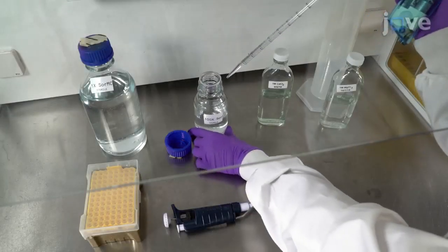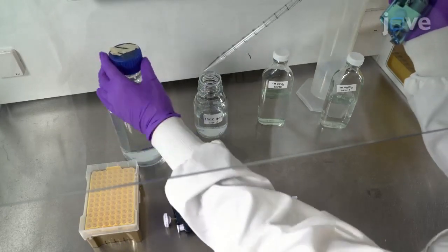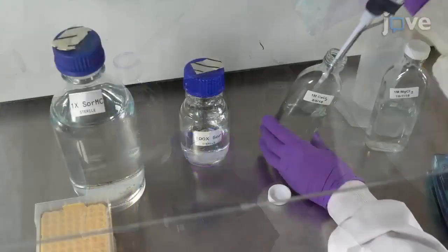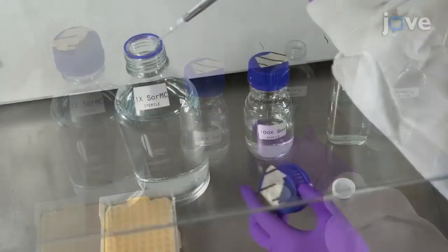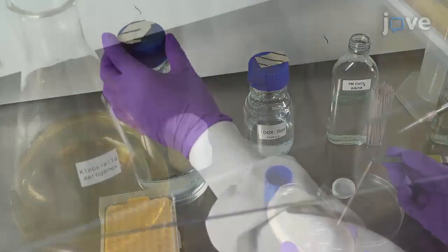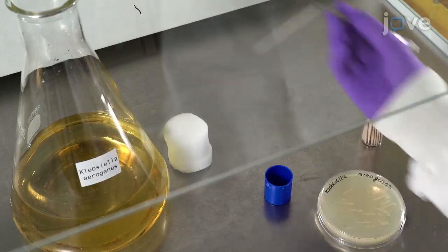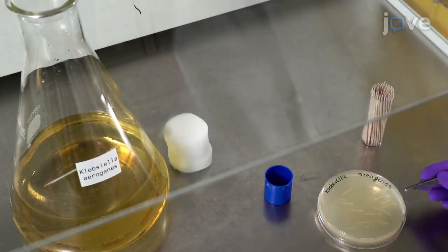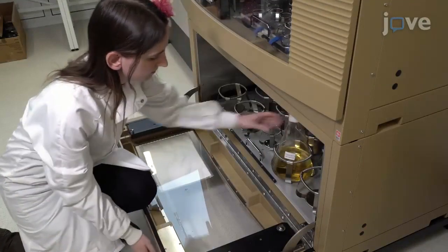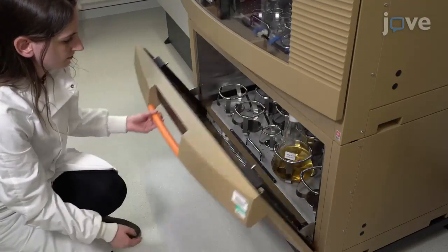To begin, prepare 1,000 mL of Sorensen buffer working solution with magnesium chloride and calcium chloride according to the text protocol. After this, use a single colony of K. aerogenes to inoculate 1 liter of LB medium. Allow the bacteria to grow overnight at 37 degrees Celsius with shaking.